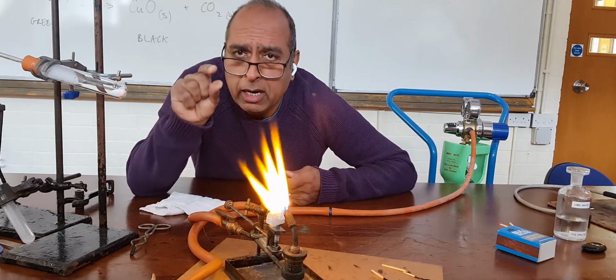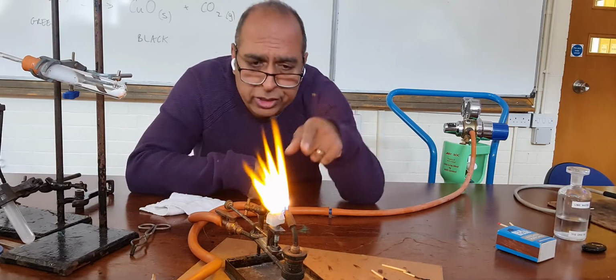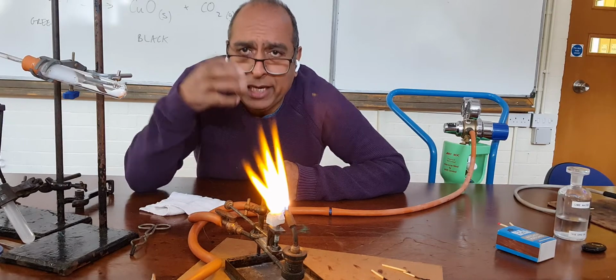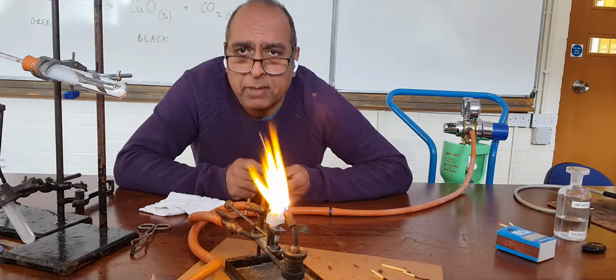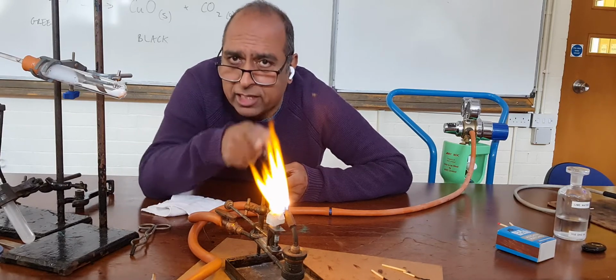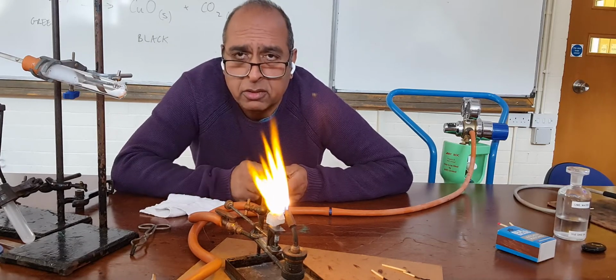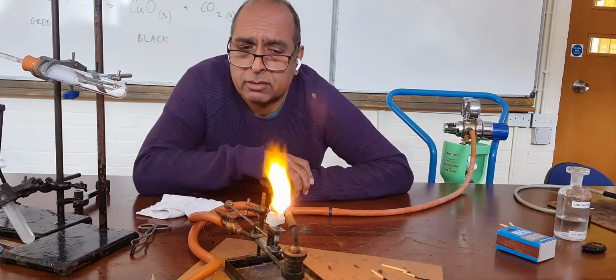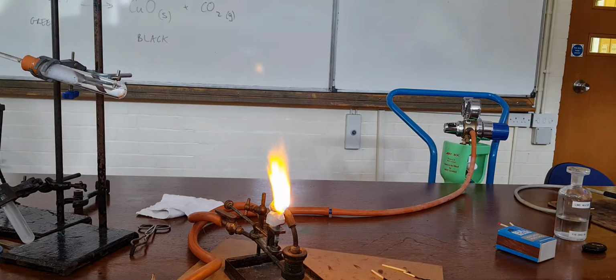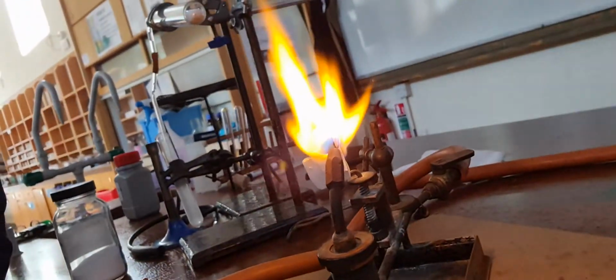That very hot lime, when it gets really hot, as you can see, it gives off a lot of light. And you may have heard the phrase, in the limelight. Well, in the limelight is this light. In theatres, before they had really powerful lighting, they used to do this. It is really, really bright.